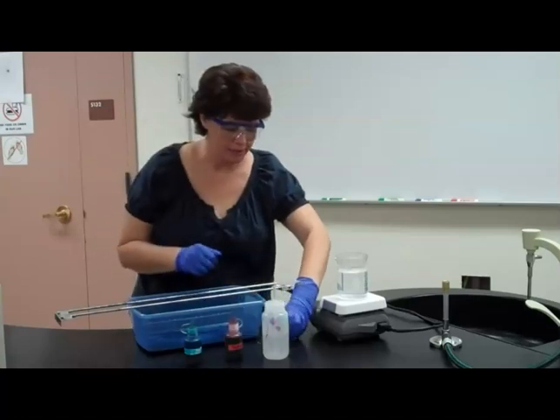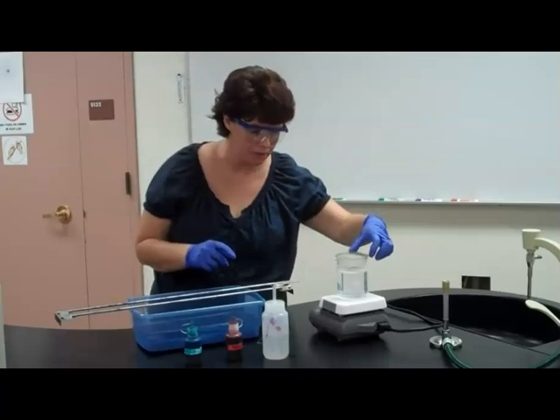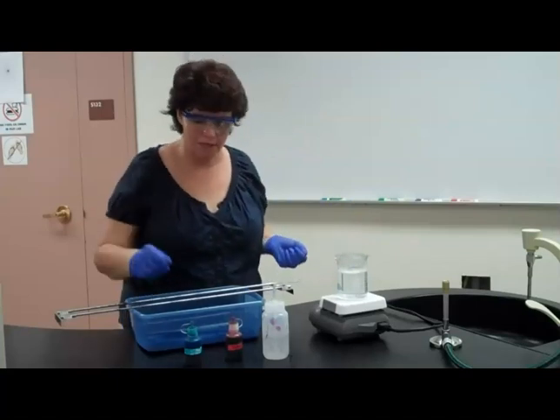So just as we did with the acid-fast stain, we're going to put our slides that already have a fixed culture on them that are labeled on our heat. And once again, we don't need it rapidly boiling, we just need to see steam coming off of it. So I can see the steam, the condensation forming.